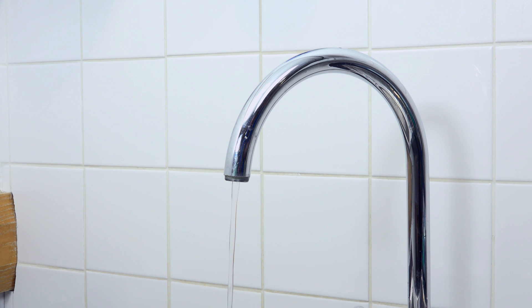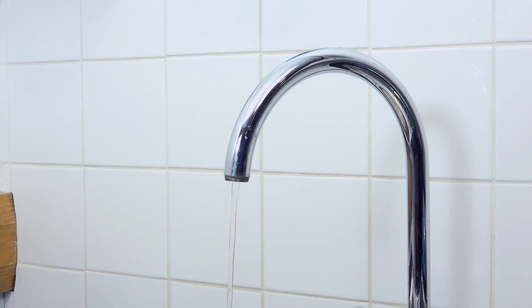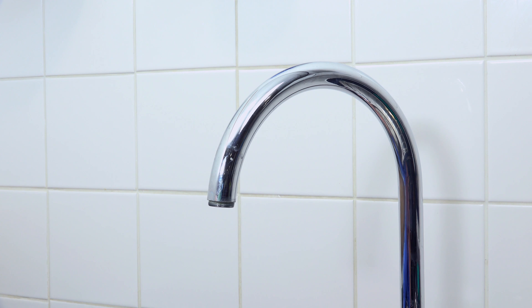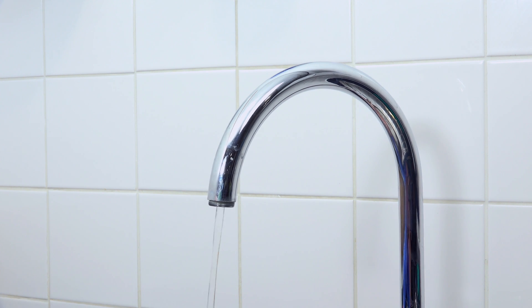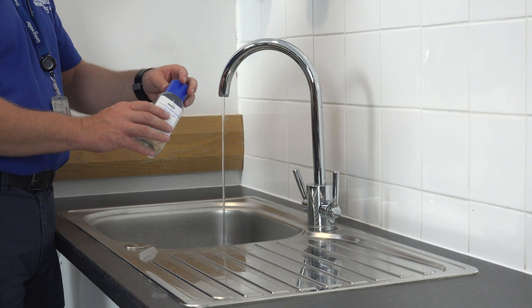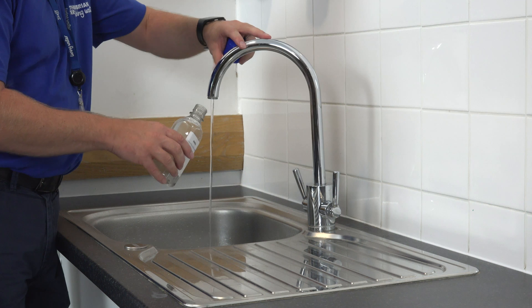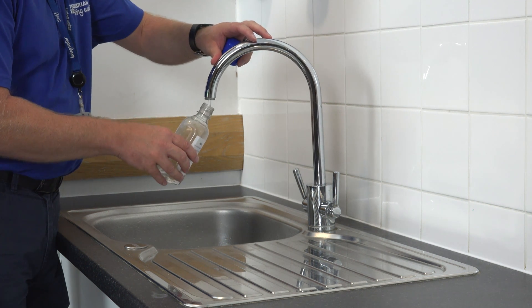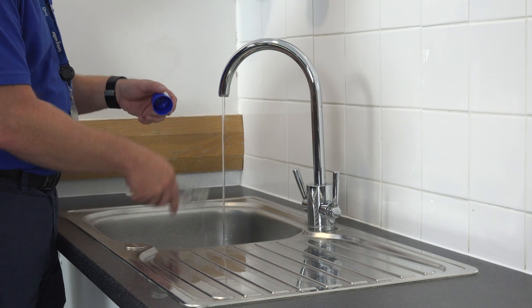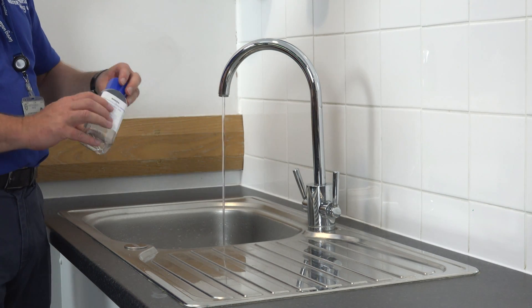When taking your samples, it's important that the flow of water from the tap is maintained at the steady, gentle flow rate. Significant changes in flow rates are problematic because they can dislodge materials from inside the pipework, which can then potentially contaminate your sample. For the same reason, if the tap being sampled is a swivel tap, it should not be moved once the flow rate has been set. If you make any of these errors, you should discard the sample and resample into a clean bottle.